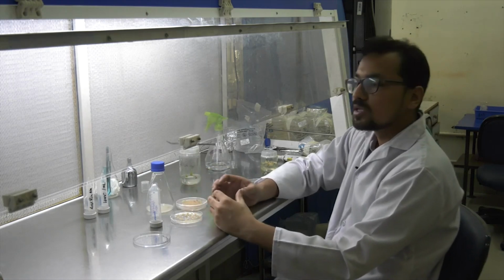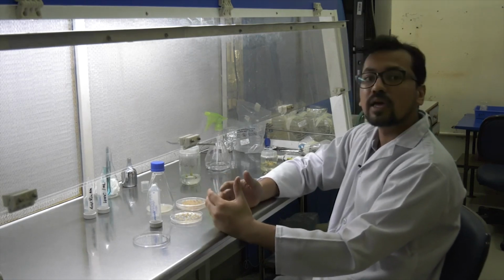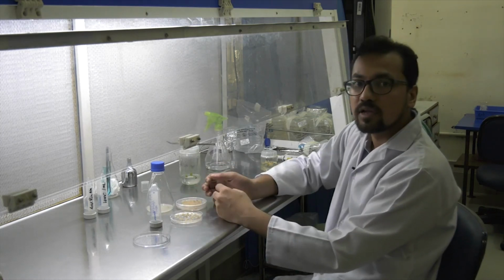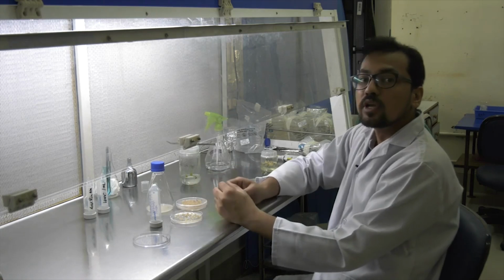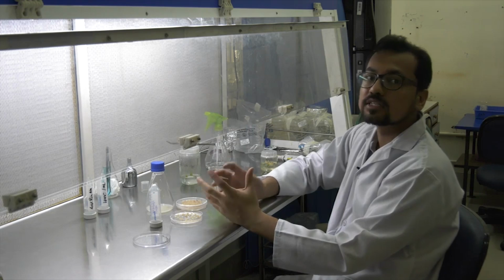Selection media is the media which contains our selection marker. Suppose my callus has been transformed with the gene of interest which I have included in the agrobacterium. Along with my gene, there is a selection marker such as hygromycin.